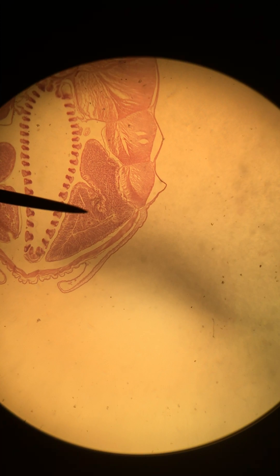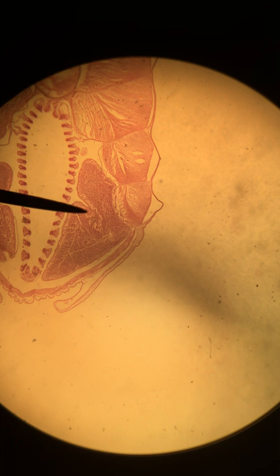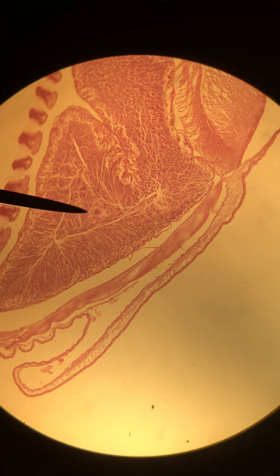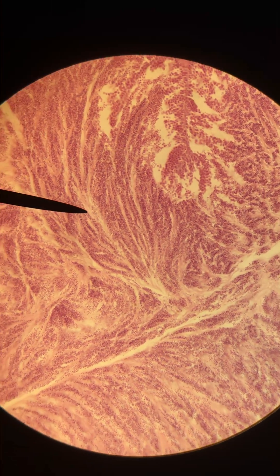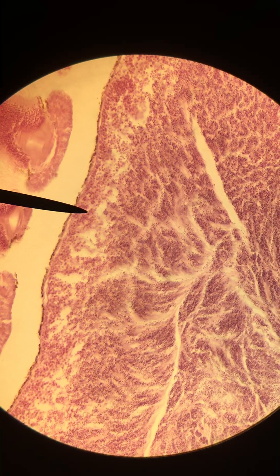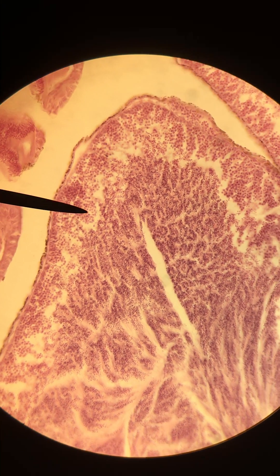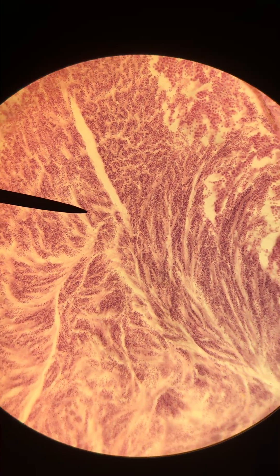Now in place of the ovaries that we had in the female, we have the testes because this is a male. If you remember, we saw a lot of circular structures in this region showing the eggs developing, and now what we see is more of a punctate or fibrous appearance to this tissue because we have sperm developing here and the cells take on a different appearance.